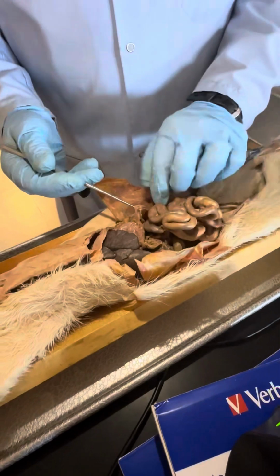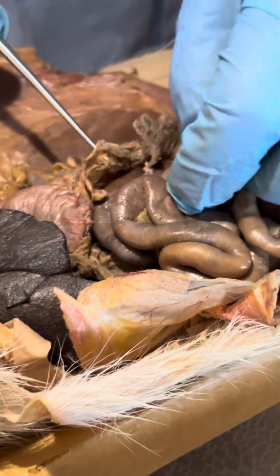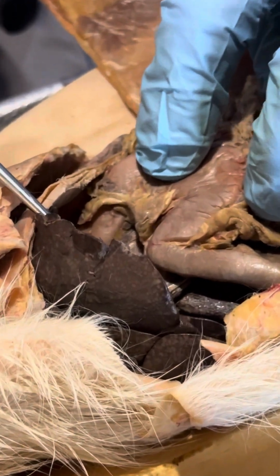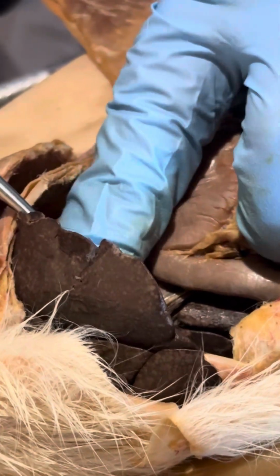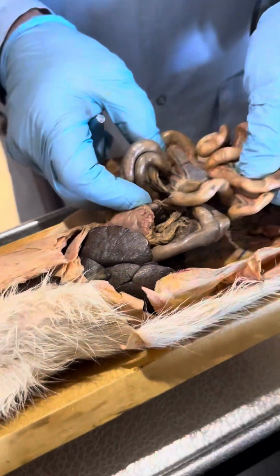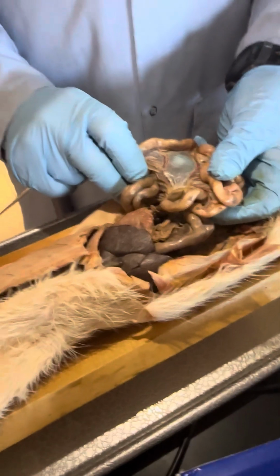All right, we have peritoneum. So we've seen the greater omentum before, right? When we looked for the right gastroepiploic. The lesser omentum has been torn. I won't be able to tag it because it's all gone, but it used to be between the lesser curvature of the stomach and the liver. And then we have this peritoneum that goes out around and back over the small intestine.